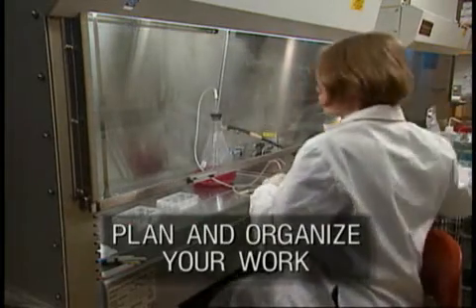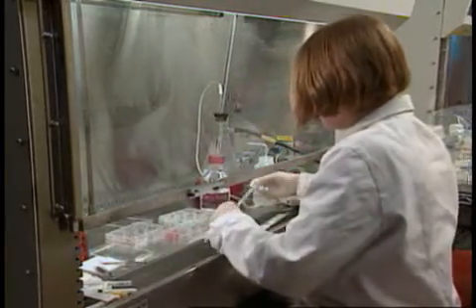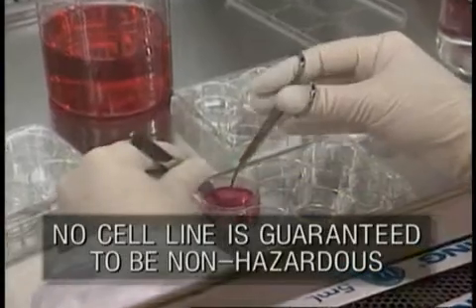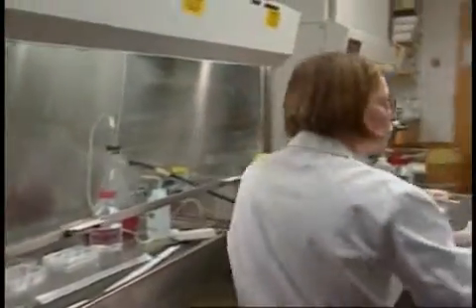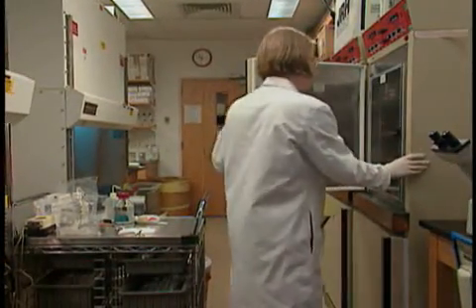Cathy knows that planning is important for good science as well as safety. Remember, moving in and out of the cabinet increases the risk of exposure. When handling mammalian blood or tissue, assume that infectious agents are present. Completing the procedure doesn't mean safety is no longer an issue — a thorough cleanup is as important as vigilance during the work.